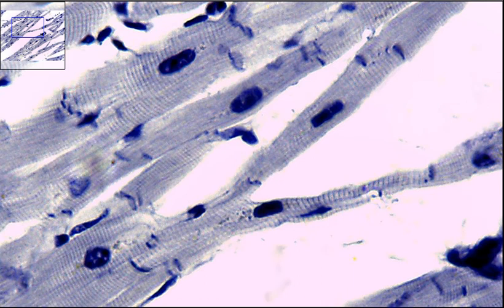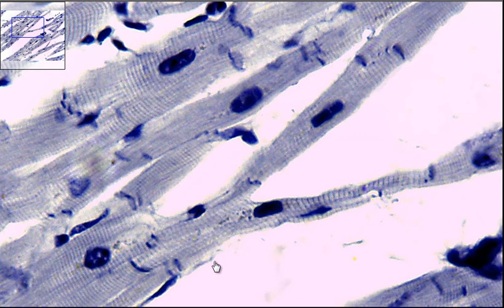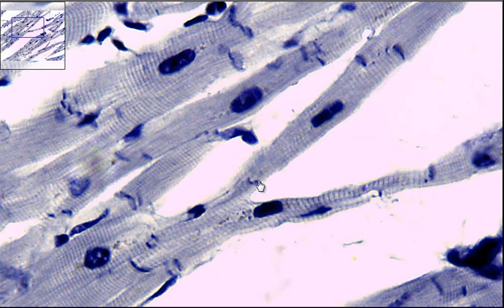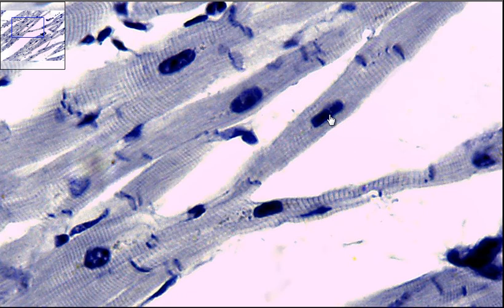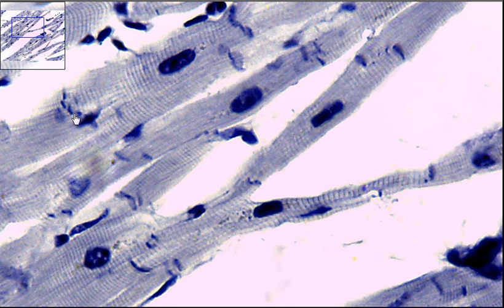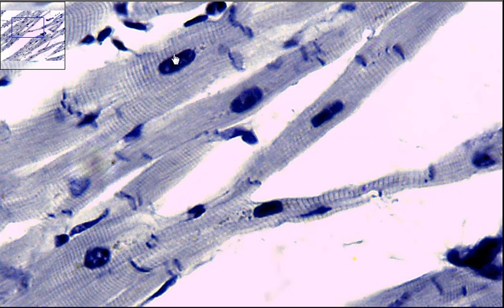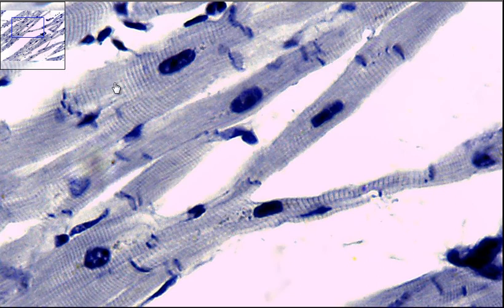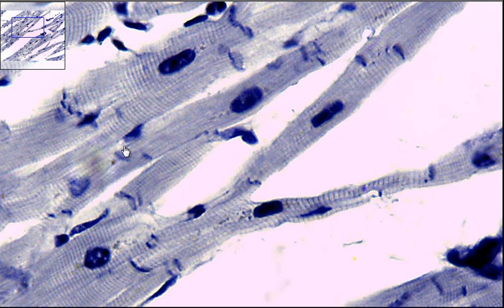The intercalated discs are actually the endpoints or junctions of your cardiac muscle cells. You can see here's an intercalated disc, and here's another one — one nucleus in between. Here is an intercalated disc, and here's another one — one nucleus in between. So this is one cardiac muscle cell, and here's a second cardiac muscle cell.